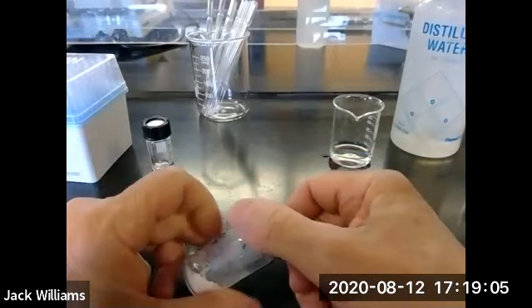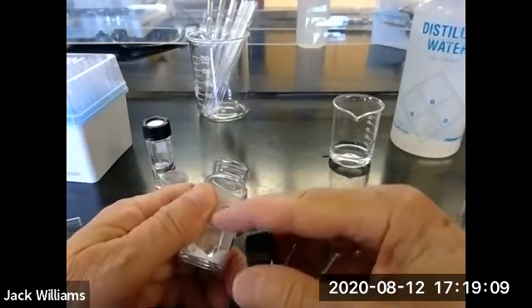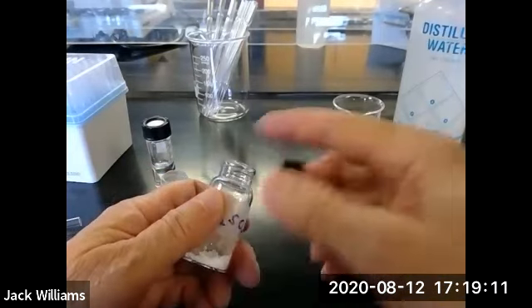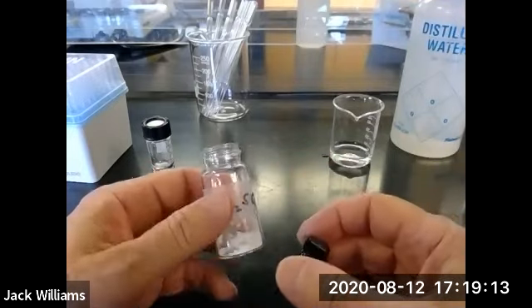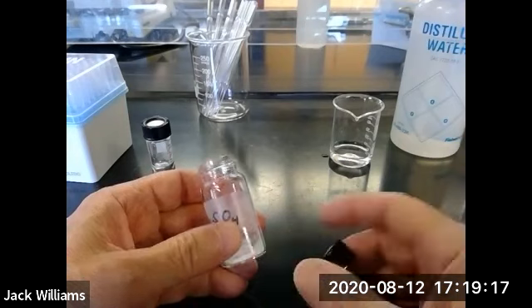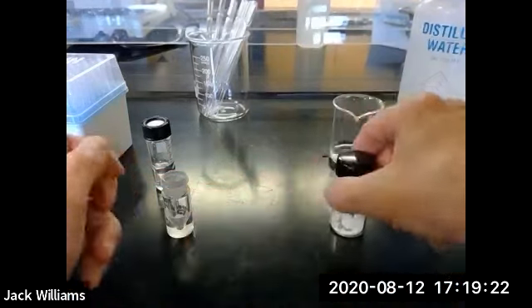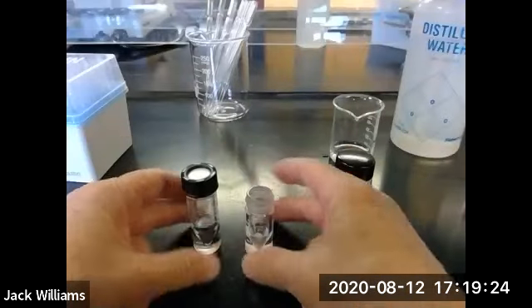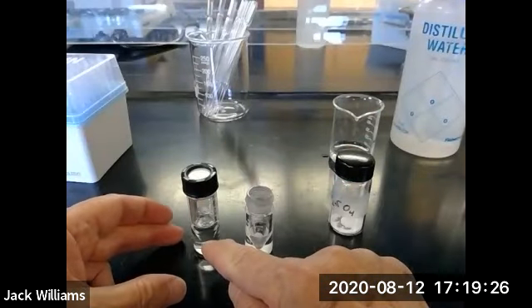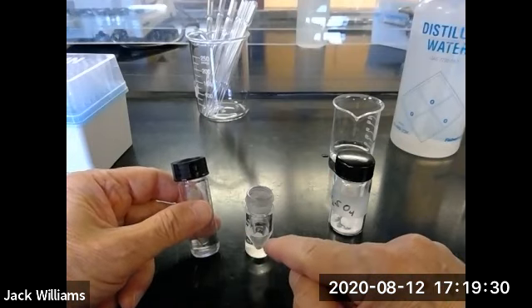Make sure that after you weigh this, you cap it, because it is a drying agent. It will absorb water. If you don't cap it, it's going to take water out of the air. It'll absorb it, and then you'll get the hydrated form, and then it will no longer work. So you want to make sure you cap that. We're all set now to transfer only the bottom layer. We only want to transfer the bottom methylene dichloride to the drying agent.